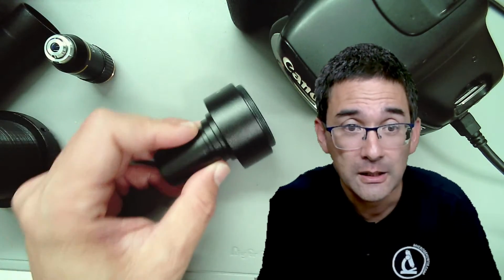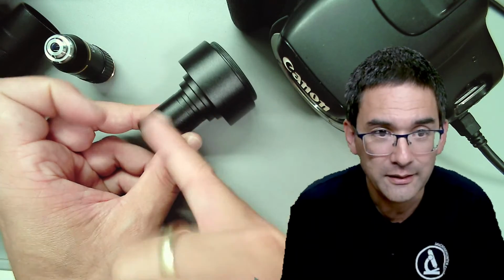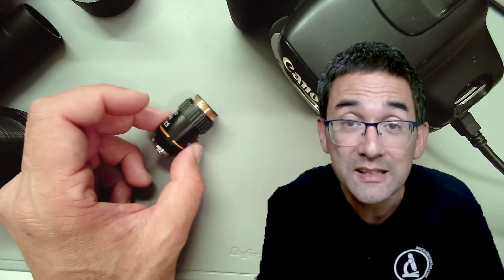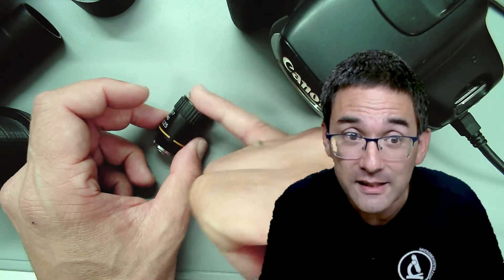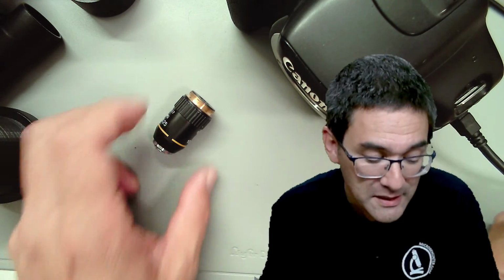Those adapters over here also try to correct this a little bit, but not perfectly. So even if you get a perfect image from the objective, the optics here kind of mess up the image quality a little bit. That's the problem. This whole issue with aberration, there's not only chromatic aberration, there's spherical aberration, and coma, and so on. There are a whole range of lens errors that have to be corrected, and better objectives correct more of these lens errors, and that's why they have, I don't know, 10, 15 lens elements in there that all compensate and correct everything. That's why some of them are so expensive.